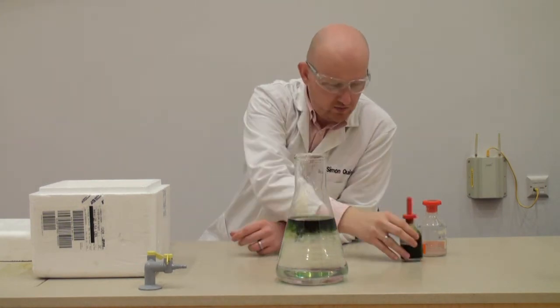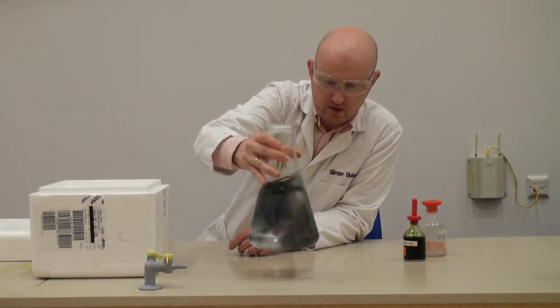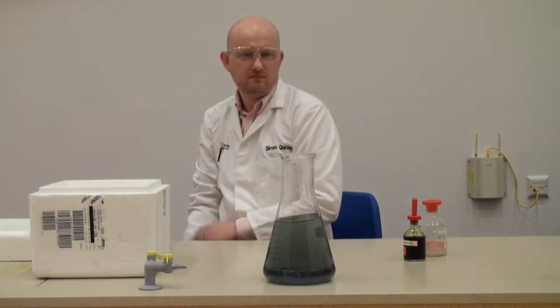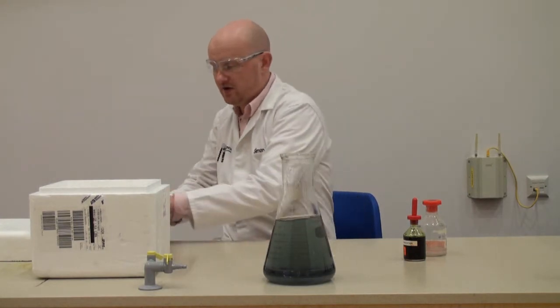Just a few pipettefuls of this. Now as I swirl it, we should hopefully have a nice blue colour, like so. Now we have that there, we have a nice alkaline solution.